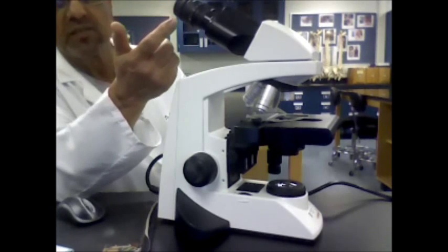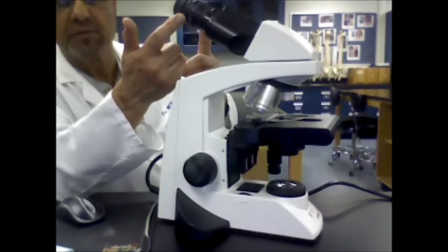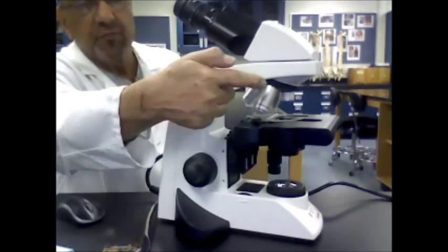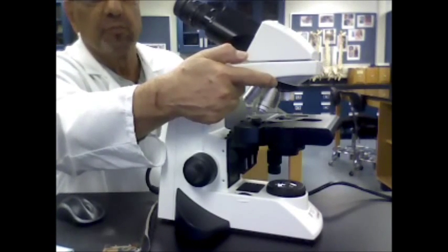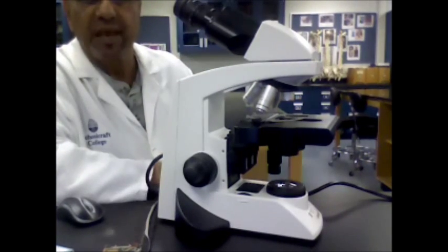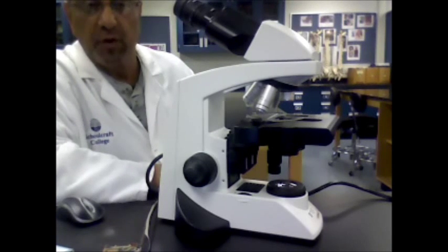You have two kinds of lenses. You have the ocular, or the eyepiece — those are the ones that you look through. And then on the nose piece of the microscope, you have four objectives. Those are called scanner, low power, high power, and oil immersion.